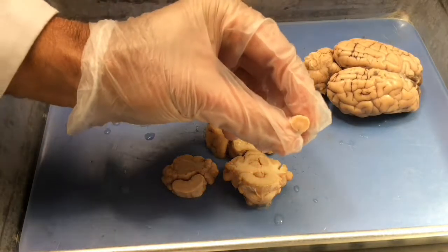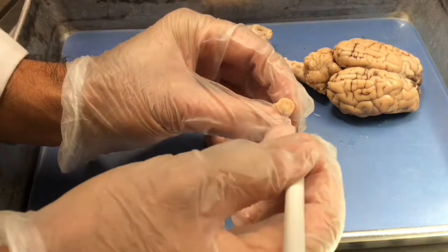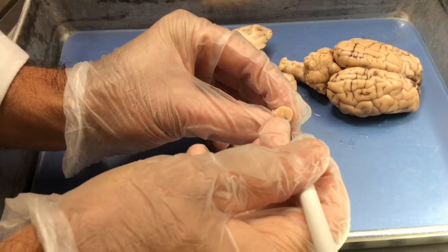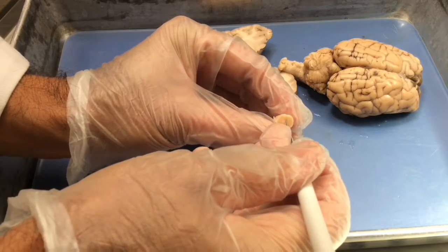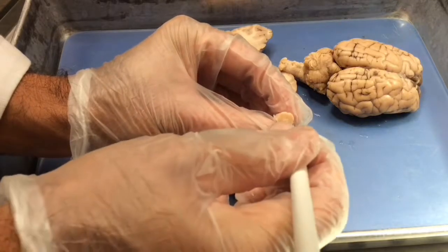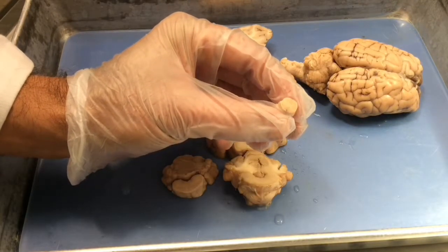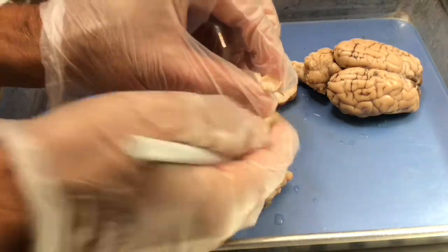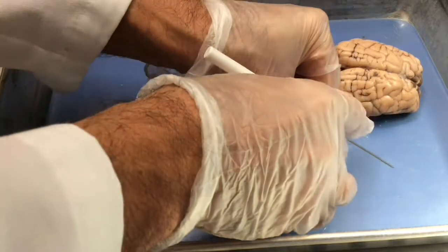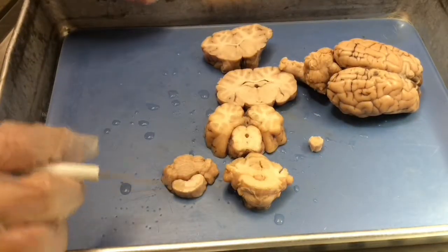So I don't know if you can see this section of spinal cord here. It's not much to look at, obviously. It's a very small structure, but you maybe can see that sort of dark dot in the dorsal middle of the section, which is the central canal of the spinal cord. Okay. Spinal cord there. So, quick little review.